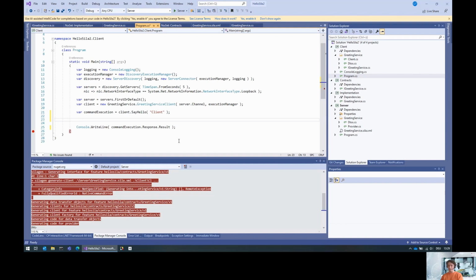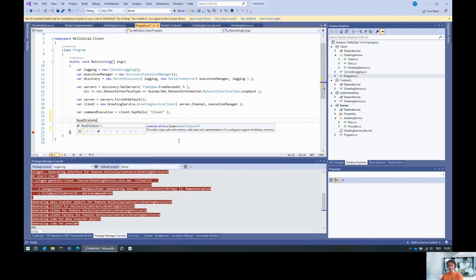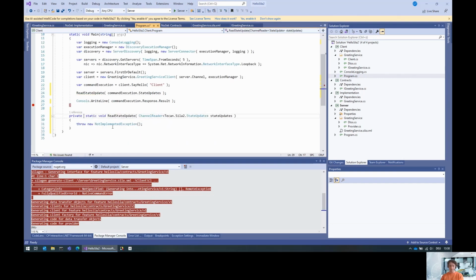And earlier than that, the API of an observable command is basically a channel. So this thing here is a channel reader of state update. So what we can do is read this thing, the state updates, and let me do this asynchronously.